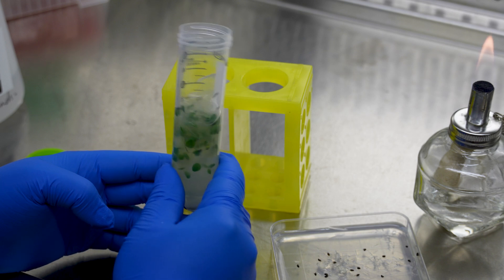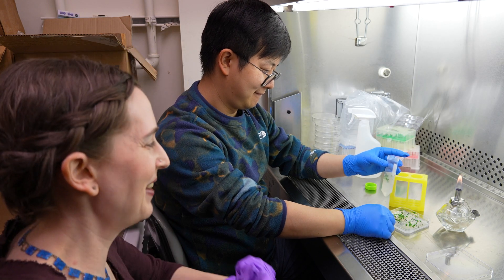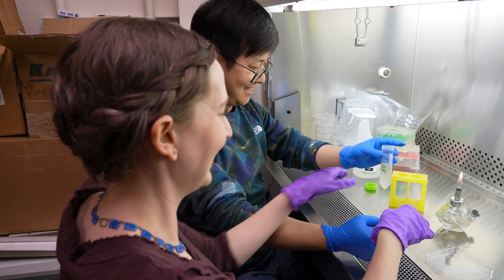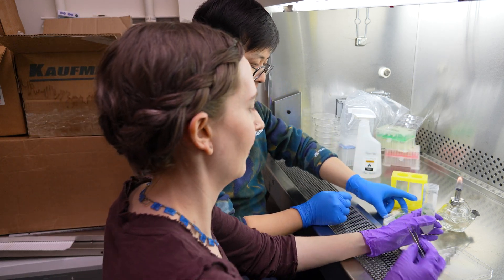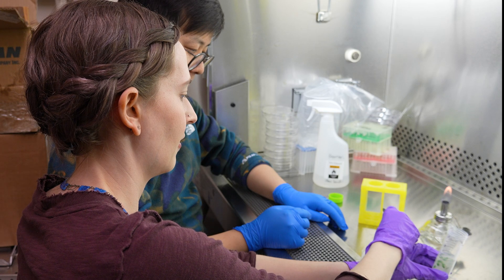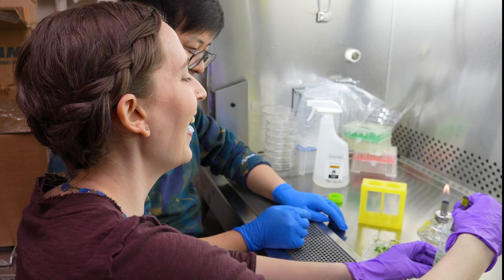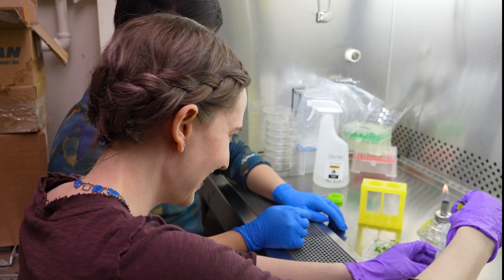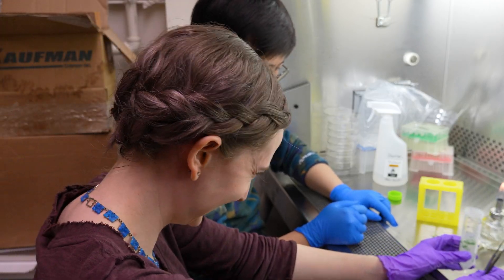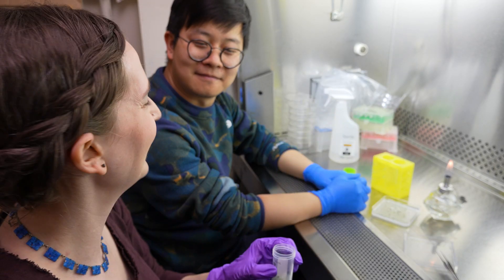Right now we're going to expose the seedlings to the Agrobacterium by submerging them into the Agrobacterium transformation solution. Time for your bacteria bath! Can I try? I can't wait to transform some columbines. So I just plunk them right in? I've been waiting nine years for this, Yan. Look at all of our little seedlings in their bacteria bath.